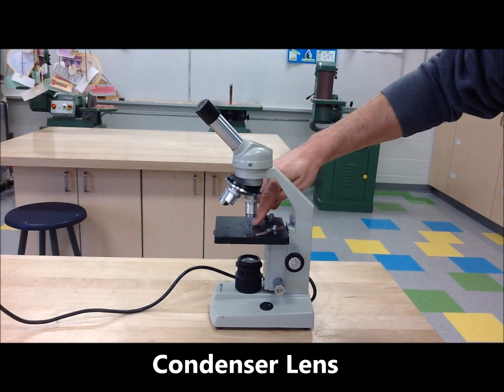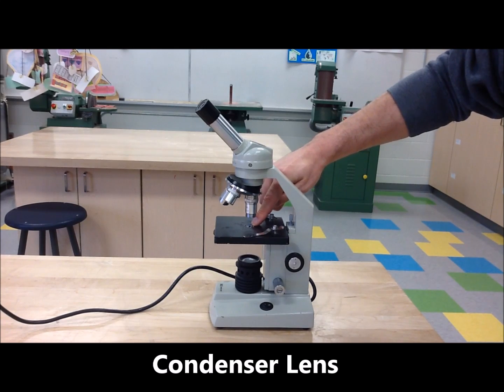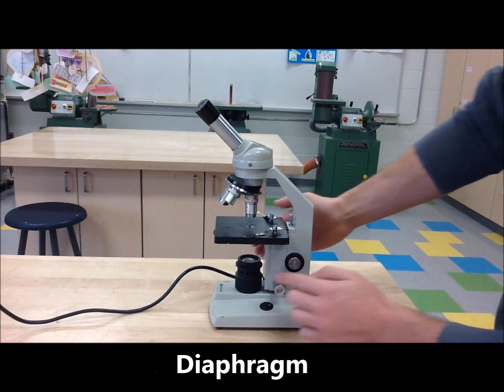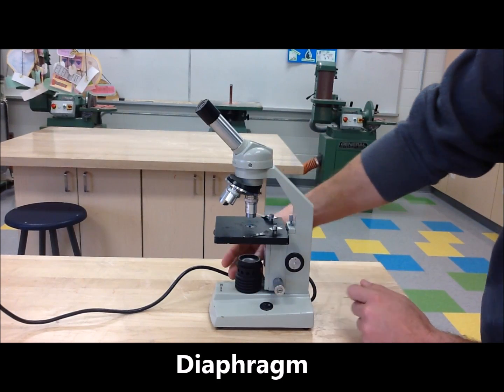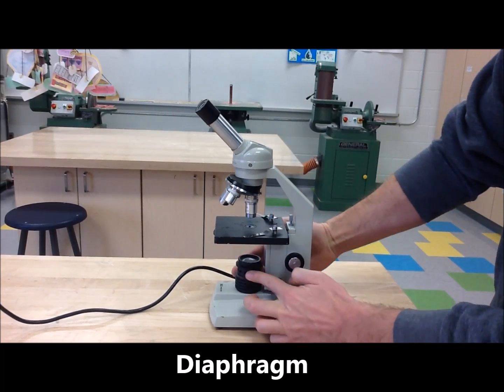Condenser Lens. It helps to focus light onto the slide. Diaphragm. Controls how much light goes through the lens.